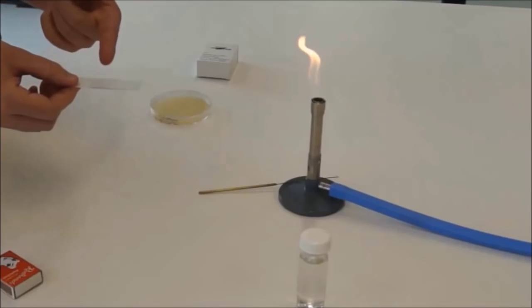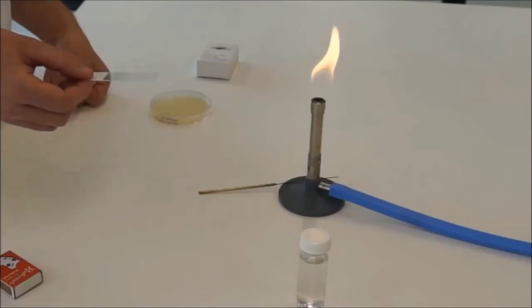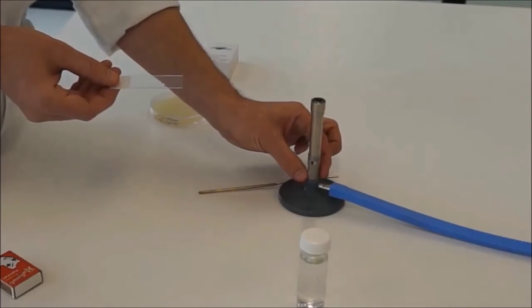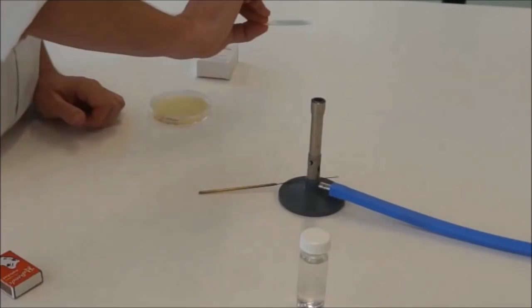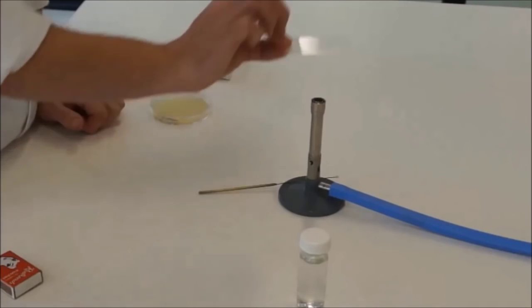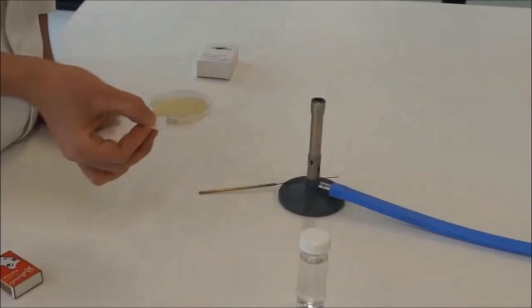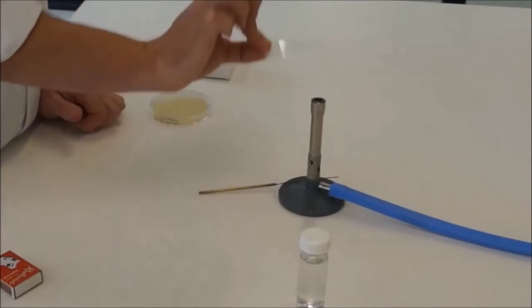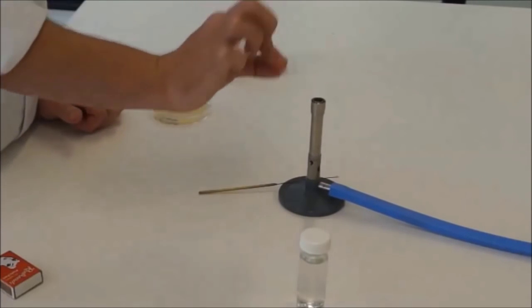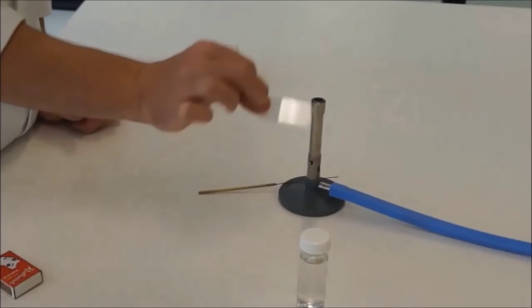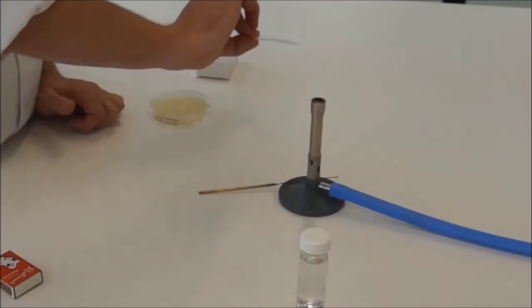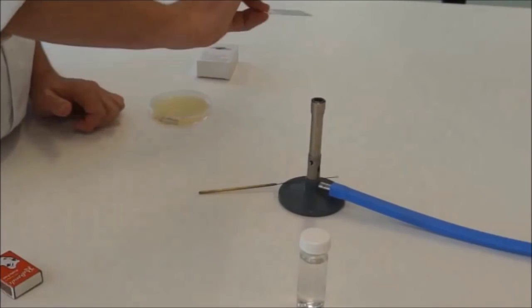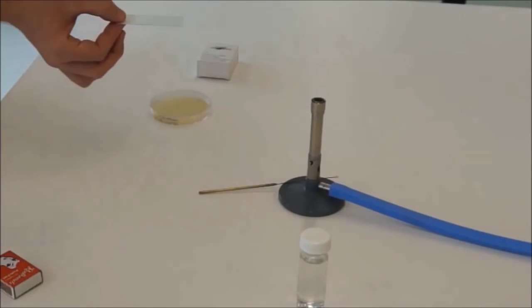The next step is to heat fix the bacteria to the slide because you're going to be washing all kinds of rinses over them in a minute. They're liquid, they'll wash bacteria off. So to heat fix the bacteria to the slide, turn the Bunsen on to hot and just swipe it through that flame nice and quick. Every now and then just observe if the water's on there. Once you've gotten rid of say 95% of the water then that's probably enough. You should be able to see sort of white cloudy stain on that slide. Alright. So that's Bunsen burner finished with, we'll turn it off.